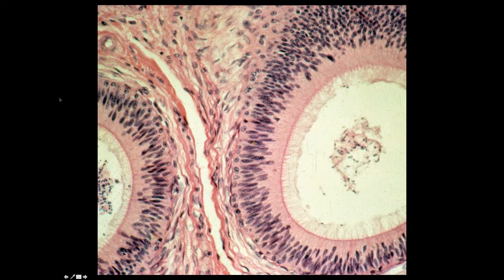This is a profile through the epididymis. The epididymis, of course, is in the male reproductive tract, and this is a pseudostratified columnar epithelium, and these epithelial cells possess a surface specialization called stereocilia. The stereocilia are seen like this. Stereocilia are essentially long microvilli. What would their fine structure be, and how would the fine structure of these stereocilia differ from that of cilia?